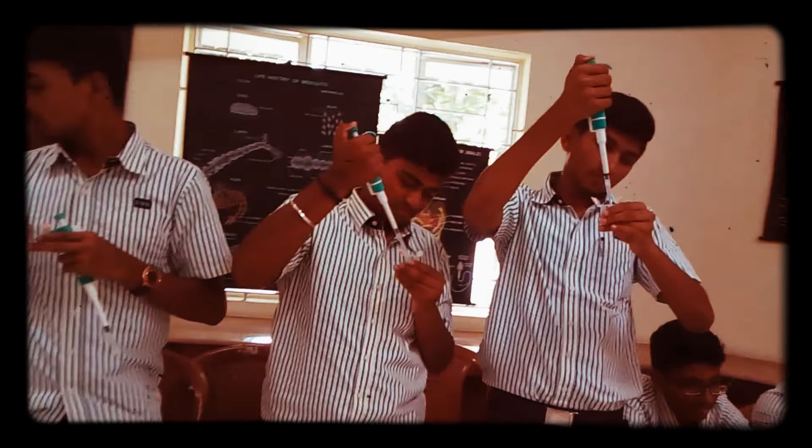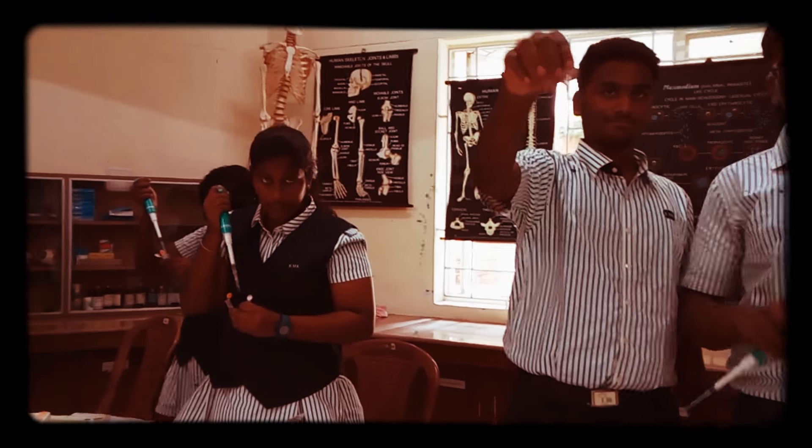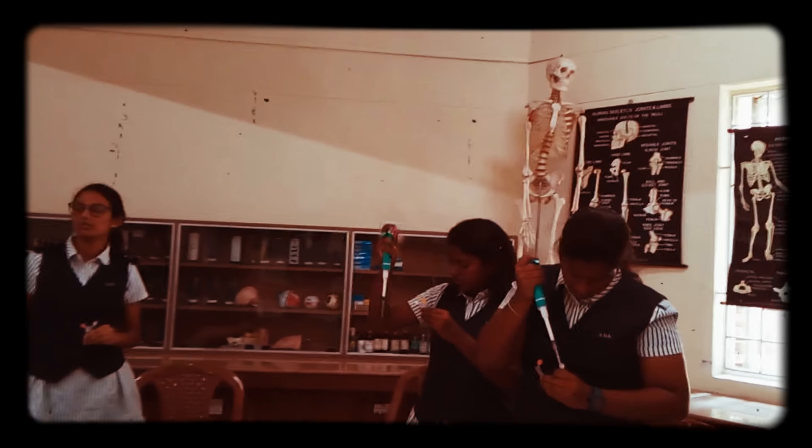It is not perfect — see, there are two types of liquid inside your second tube. For me, this is not complete. It is okay. See, the lower liquid is coming inside the bottom.